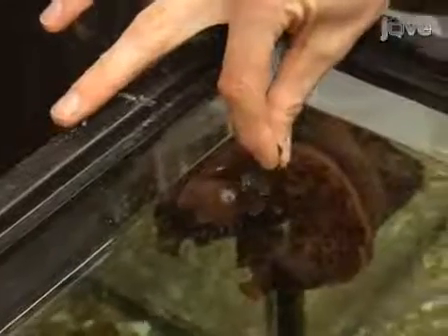Hi, I'm Miranda Cullins from the laboratory of Dr. Hillel Chiel in the biology department at Case Western Reserve University. Today, I'll show you a procedure for assembling and implanting electrodes for in vivo recordings in Aplysia californica. We use this procedure in our laboratory to study the neuromuscular control of feeding in Aplysia. Let's get started.